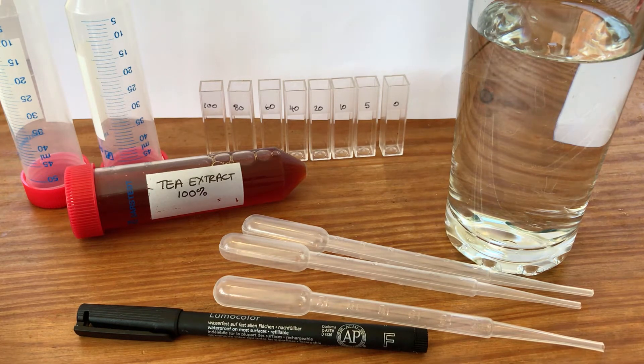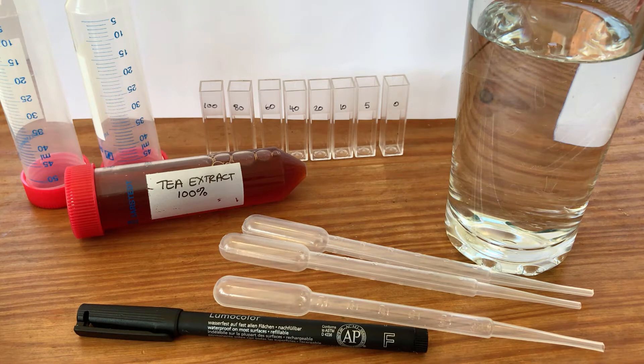In this video I'm going to show you how to set up the calibration curve for the tea extract experiment that we've asked you to do.